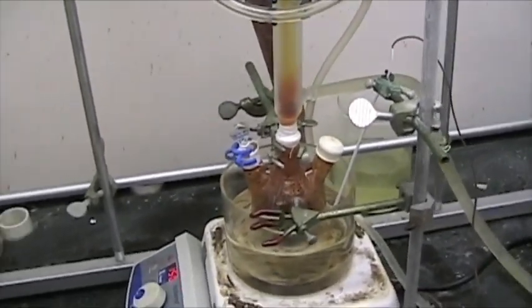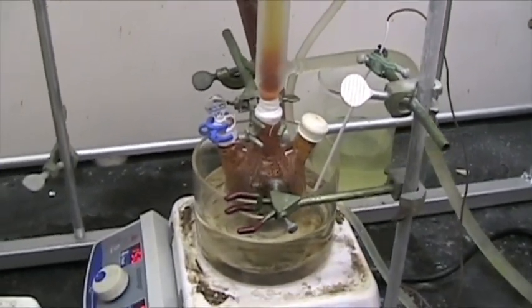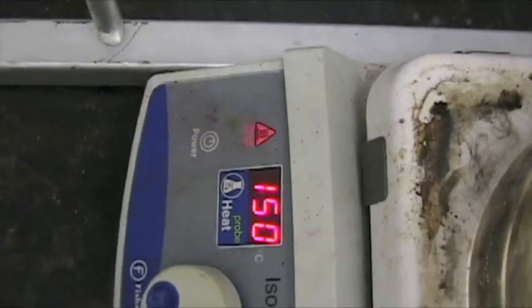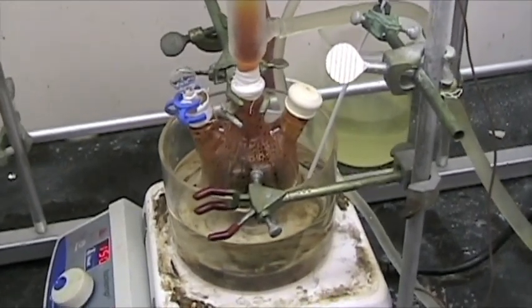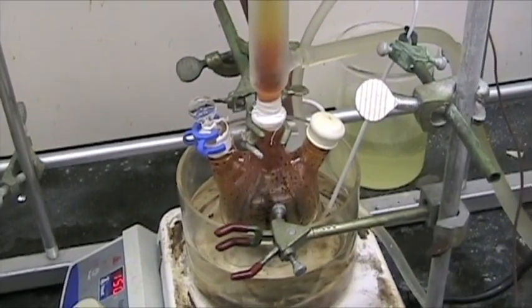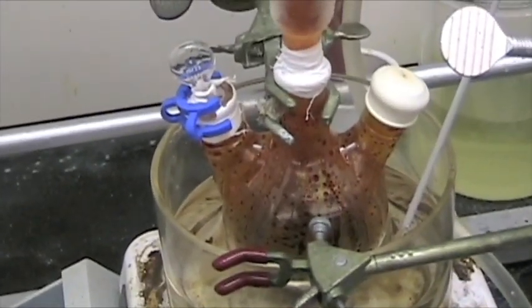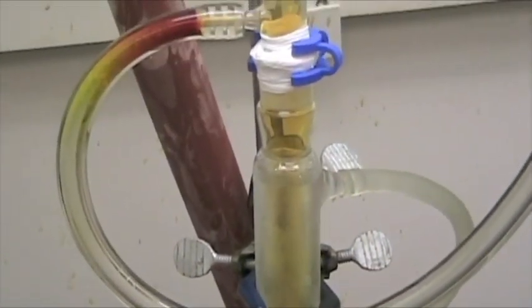Another quick one from the lab. This is a reaction that's been giving me so much trouble — it's driving me up the frickin' wall. Because at this stage where it's being heated — and as you can see it's being heated at 150 degrees C — it tends to not like that very much. But so far it seems to be okay. It actually technically needs to be heated hotter, but I'm trying to avoid a disastrous end. That inside there has that wonderful orange color, and that wonderful orange color creeps up — it's insidious, this stuff.